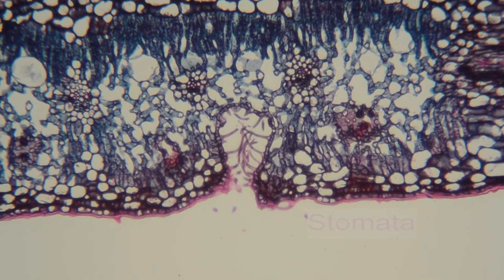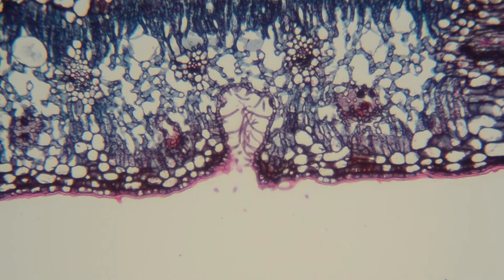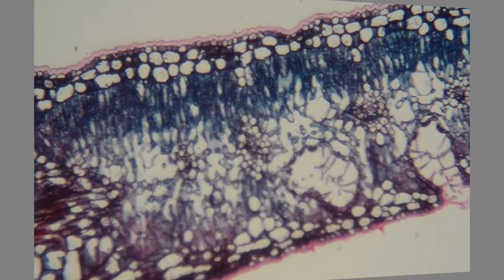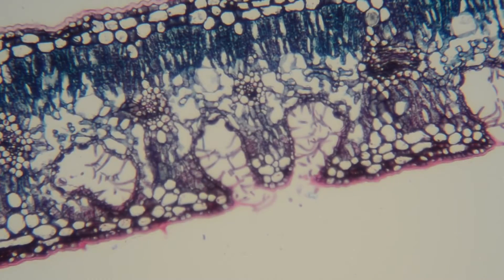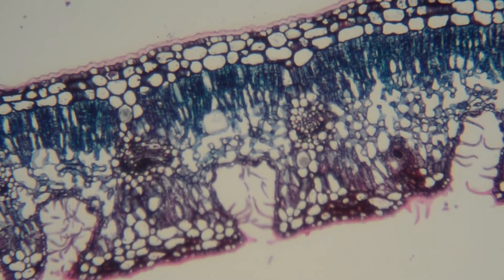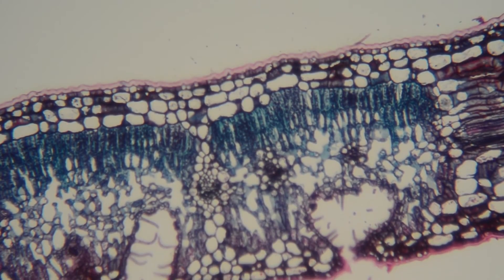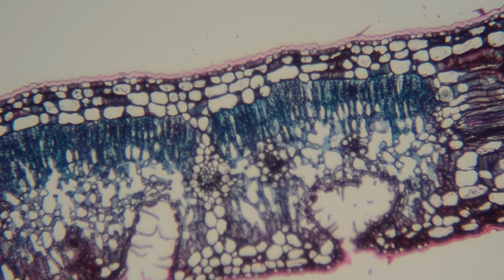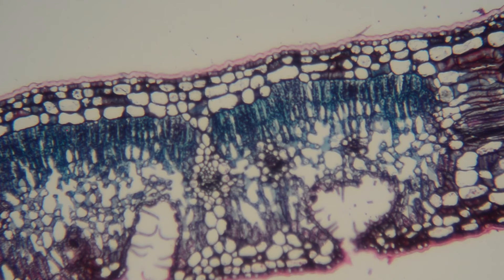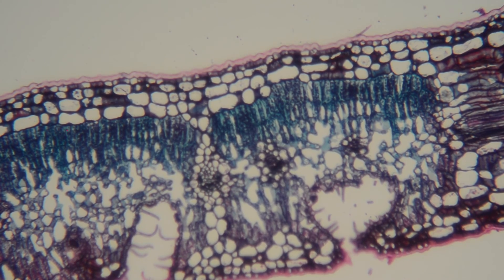I think that there might be a stomata — not certain, it just goes in slightly there. Anyway, that's just a very quick look at a leaf cross section under the microscope at 100 times zoom.